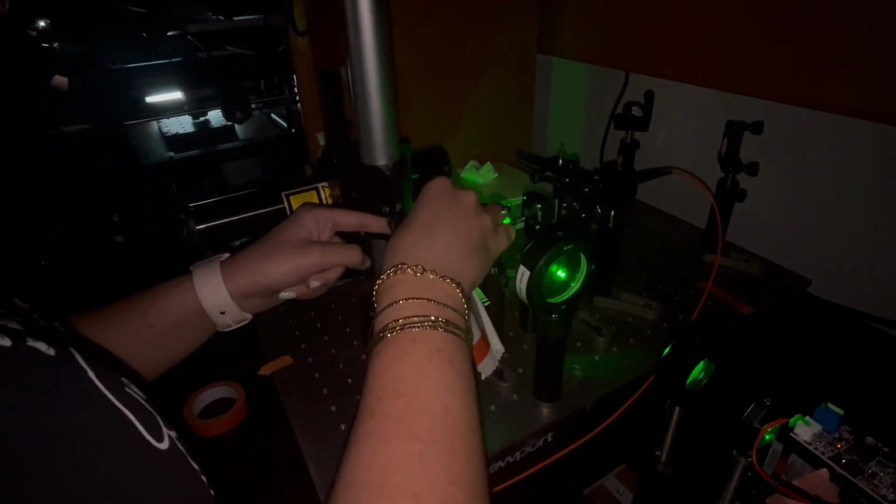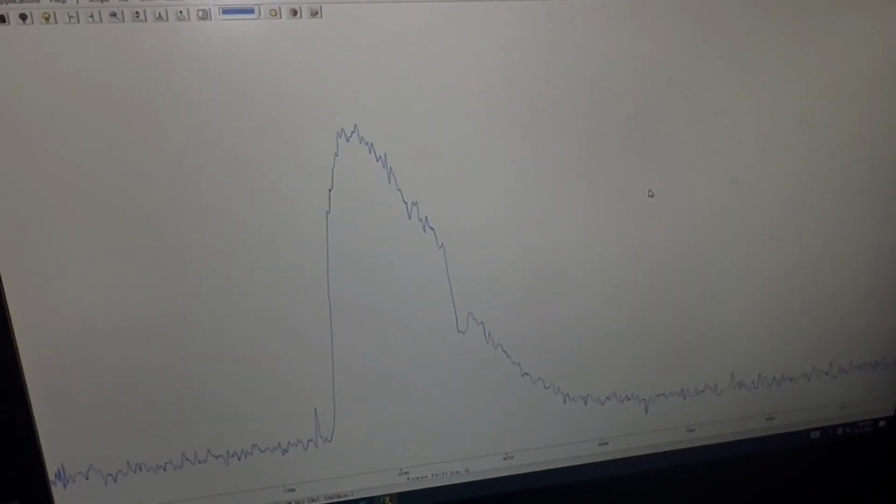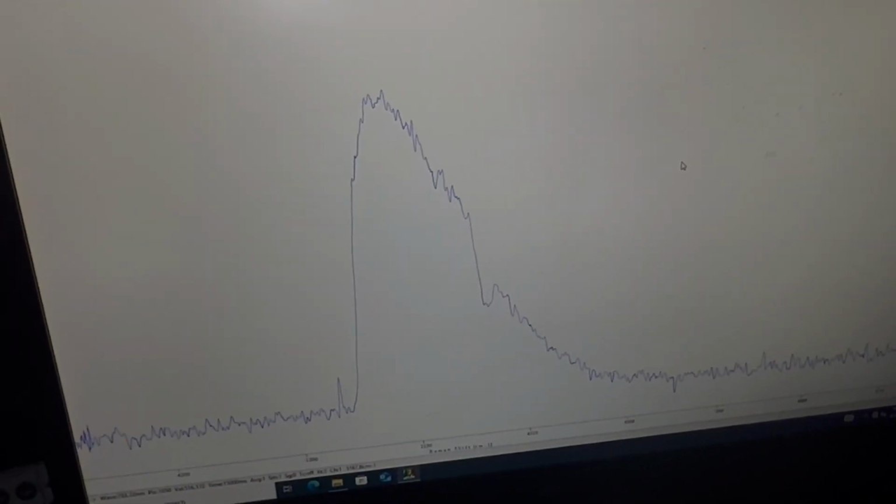As expected, all 3 trials resulted in spectrums that were comparable to each other, as the Raman fingerprint of the cotton sample should be mostly consistent from trial to trial. The only inconsistencies should be due to noise and fluorescence, which will need to be filtered out on the software side later on.